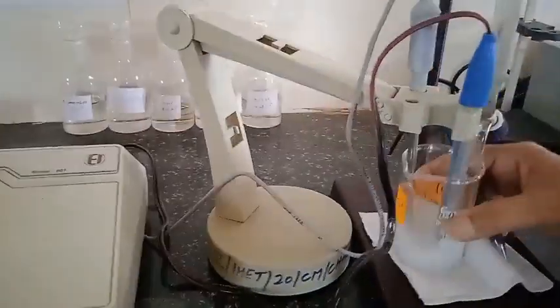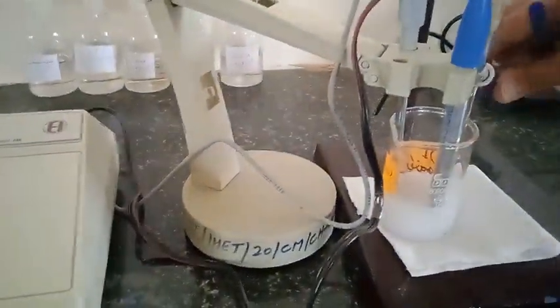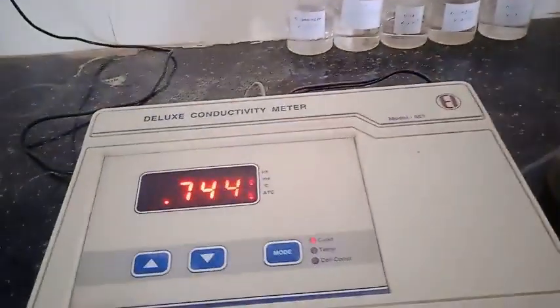The conductivity reading increased, and now the reading starts increasing. I am going to add 2–3 ml more to this solution so that I can reach up to a maxima to draw the graph. Now I am going to show you all the readings in the Excel sheet which I have taken, and the final conductivity reading which I have taken is as shown.